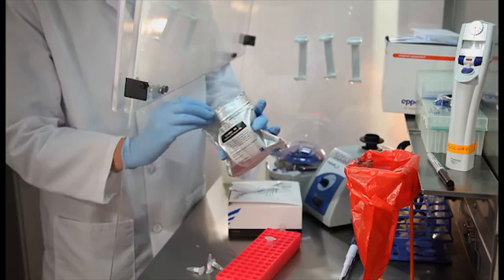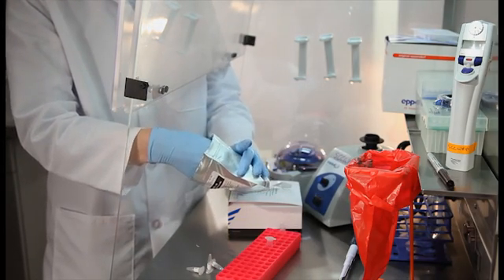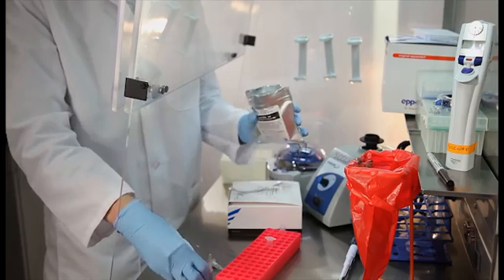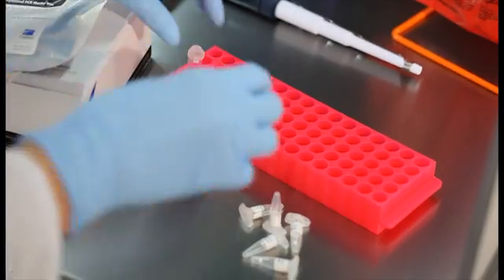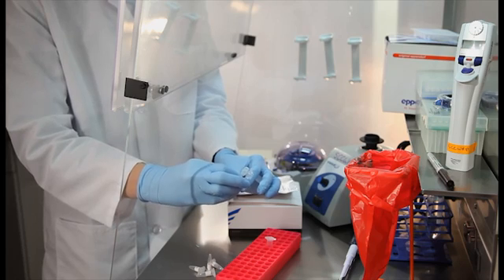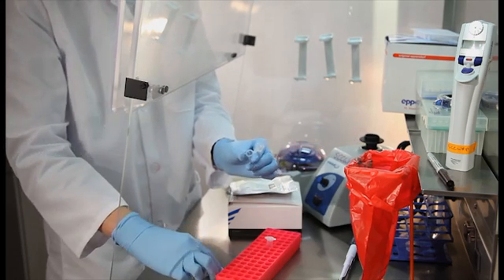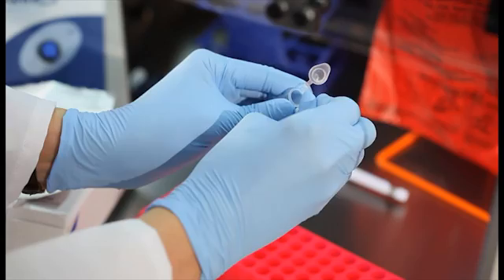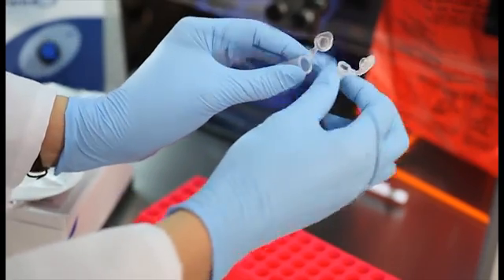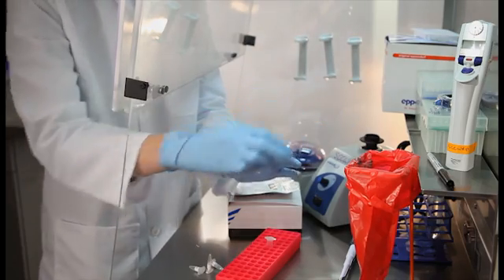Calculate the number of beads necessary to run a four-point standard curve, each sample, the negative extraction control, and a no-template control in duplicate. In general, it is good practice to prepare an excess of about 10% to account for pipetting error. Sequester the proper number of Omnimix beads for the specimen processing control assay in a microtube.